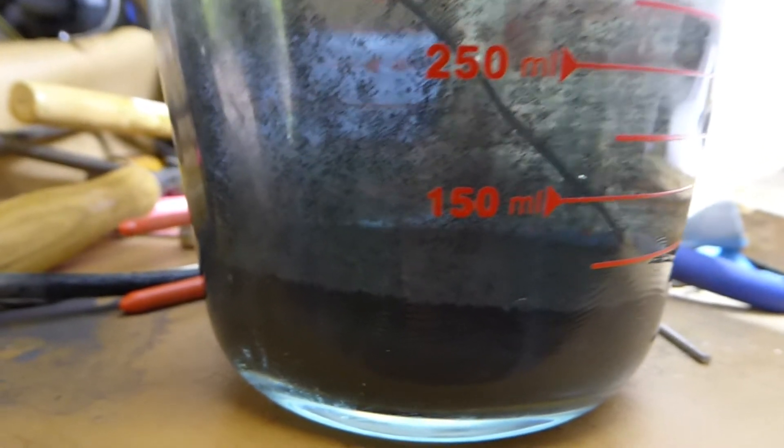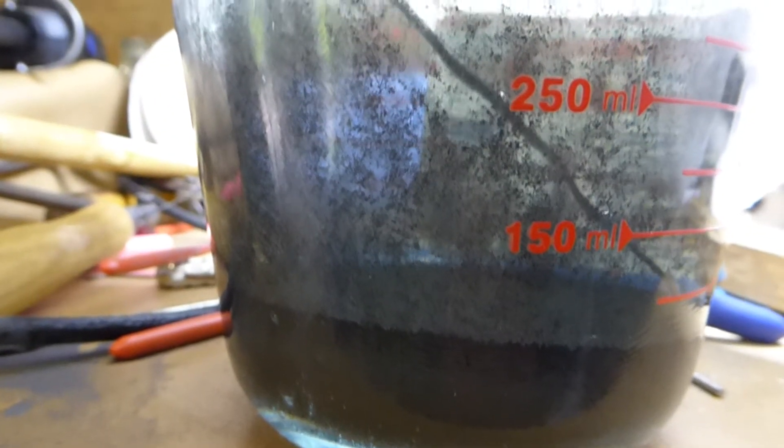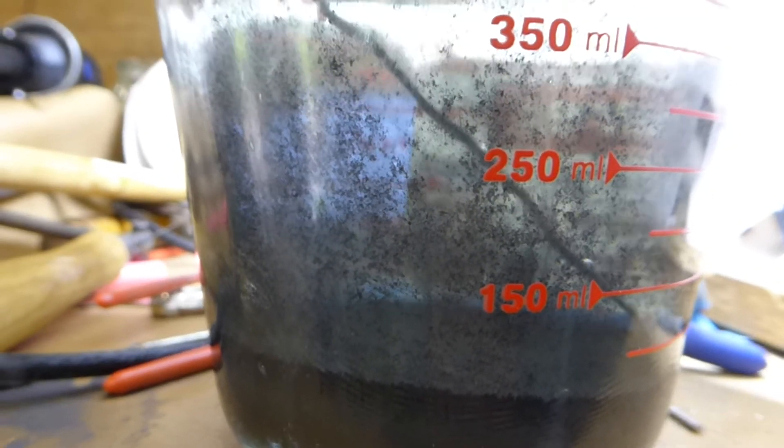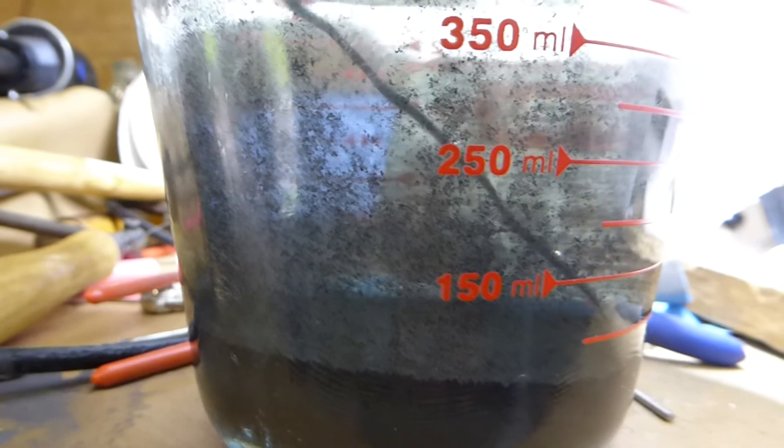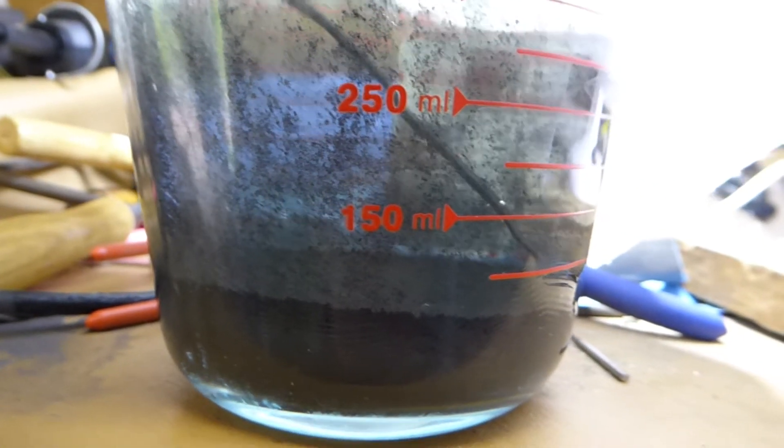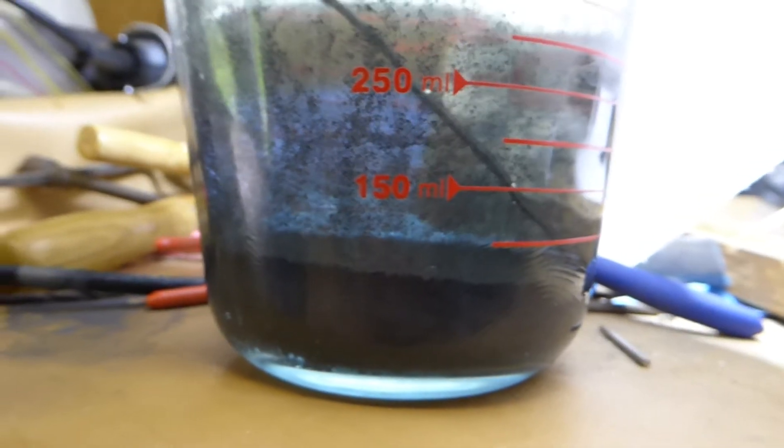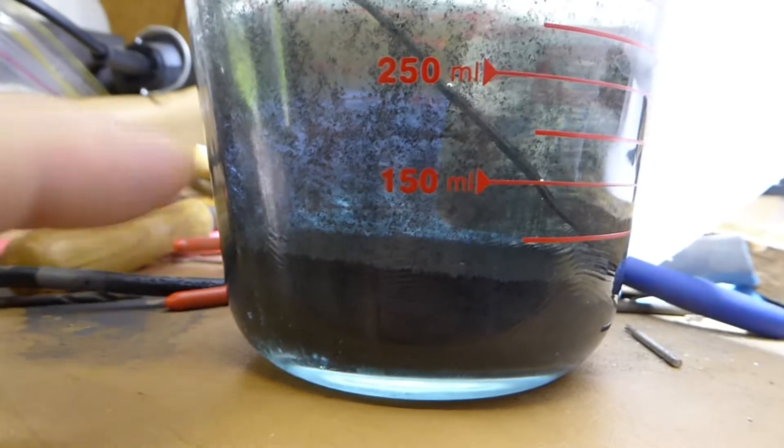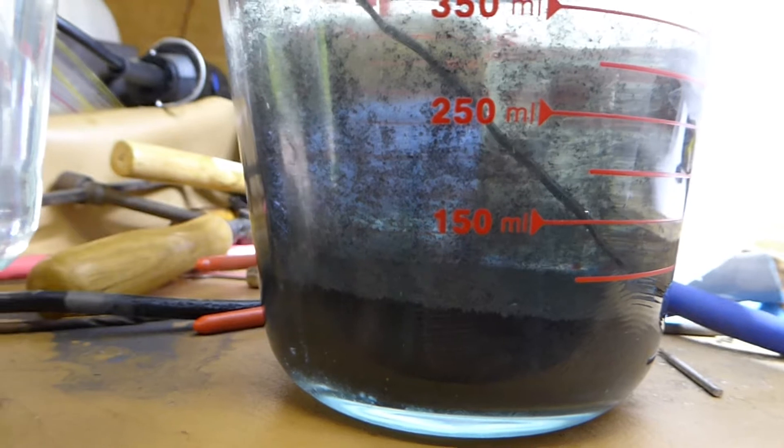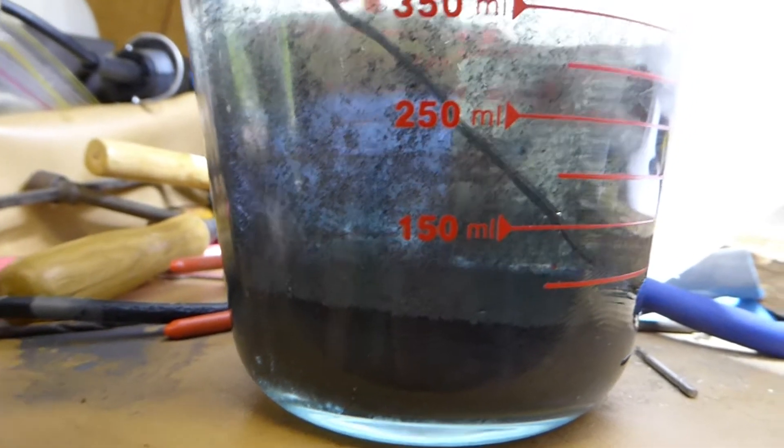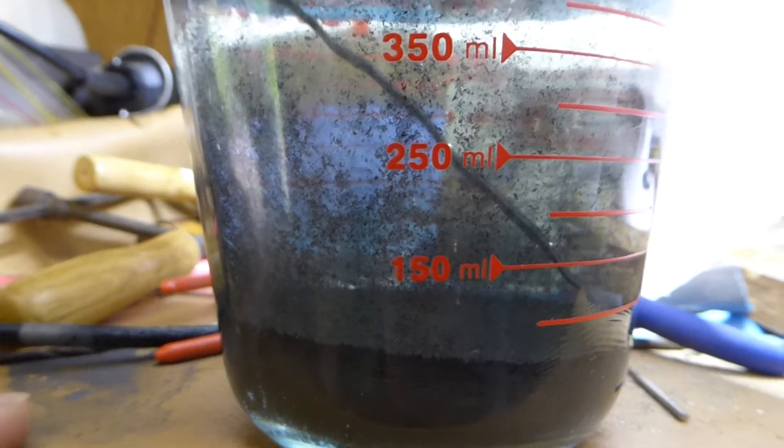Why are there bubbles coming off the bottom? Does anyone know? Look at all those bubbles. What are those bubbles?